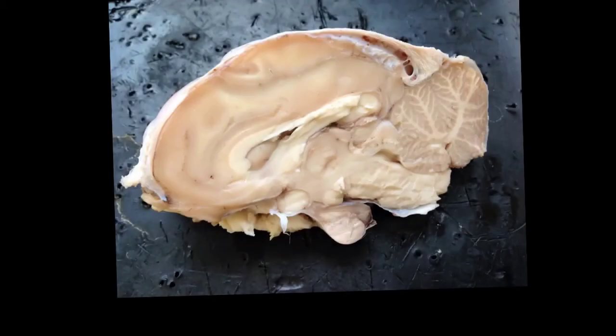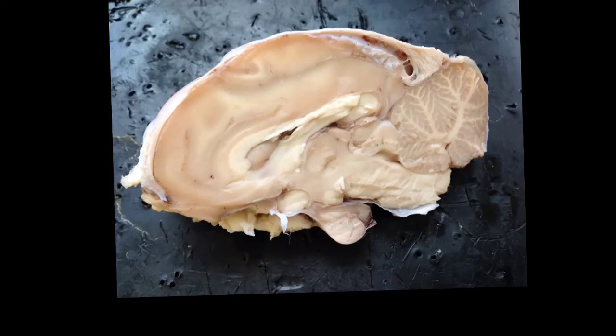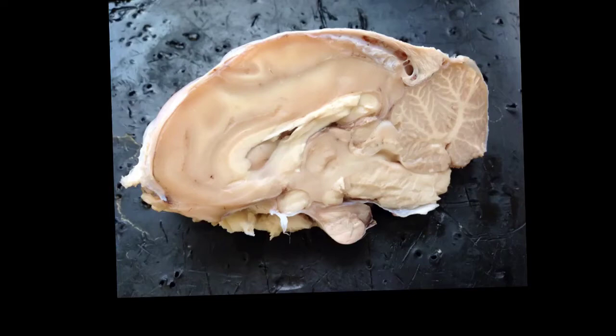We're going to go through the mid-sagittal section of the sheep brain dissection using the picture you see right here. Please refer to page 11 of your packet in the section labeled mid-sagittal section of the brain. Let's look at some major features here.